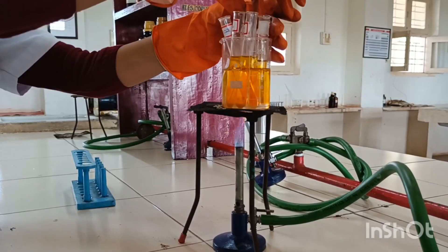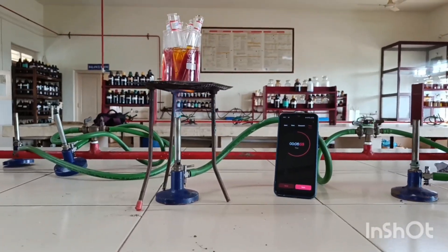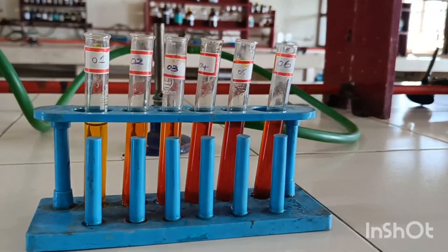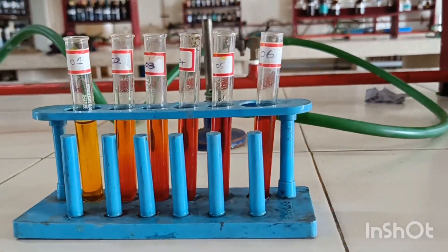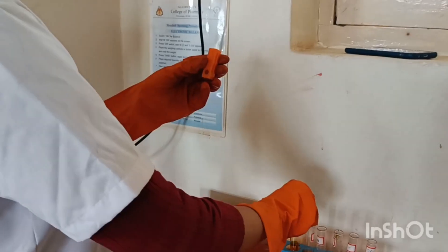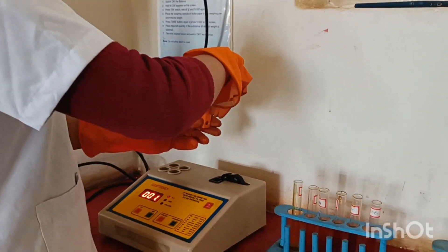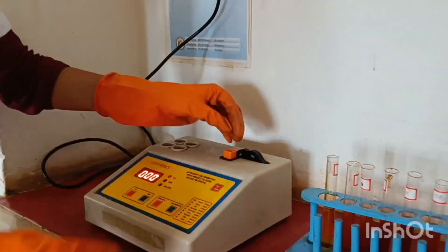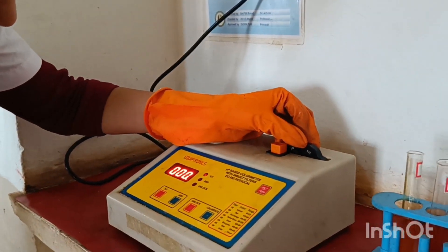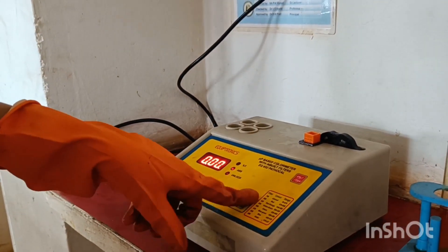Keep the test tubes in a boiling water bath for 10 minutes. After boiling, allow to cool and keep aside for some minutes before proceeding to the next step.